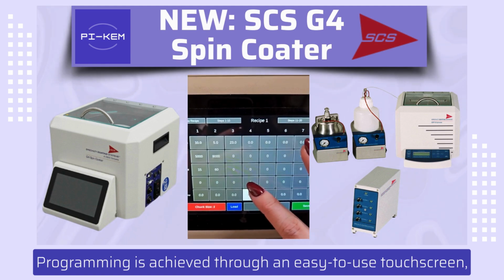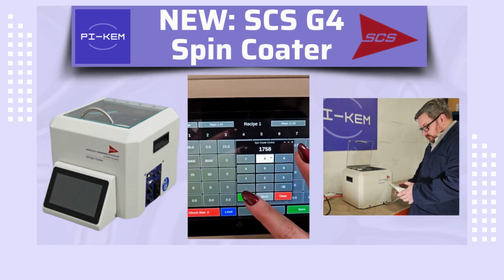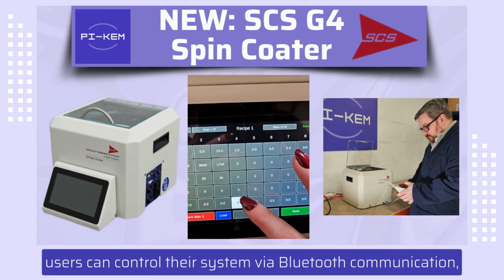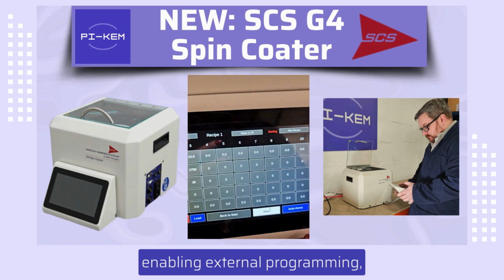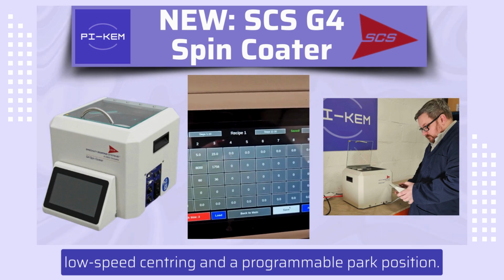Programming is achieved through an easy-to-use touchscreen, which is removable for use in glove box and fume hood configurations. When paired with SCS's proprietary Windows-compatible software, users can control their system via Bluetooth communication, enabling external programming, profile storage, diagnostics, vacuum control, low-speed centering, and a programmable park position.